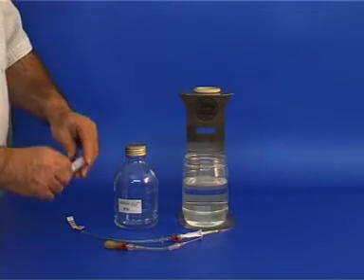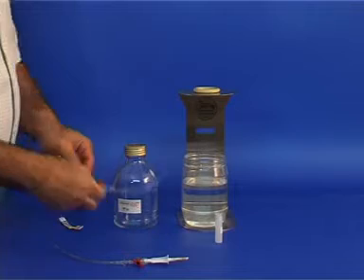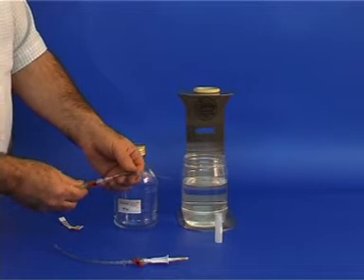We also have a small vial with the pH indicator, a spike assembly, and a small syringe needle with a dropper and a valve.